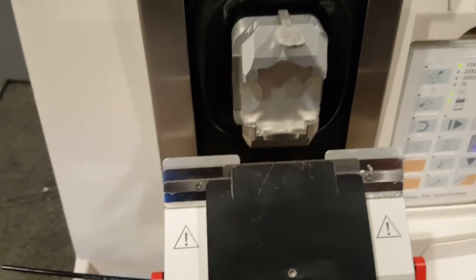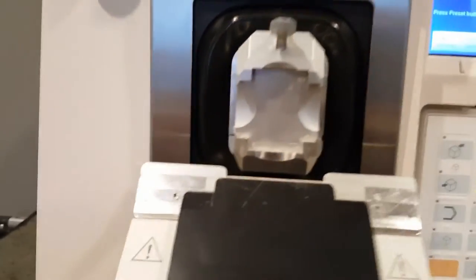There's the lock. I'll grab my block right here — I'm trying to do this all with one hand.